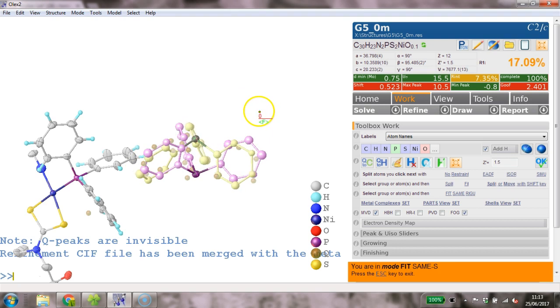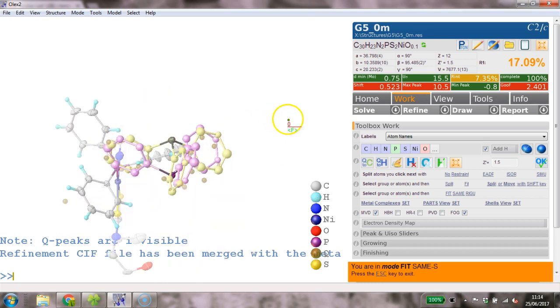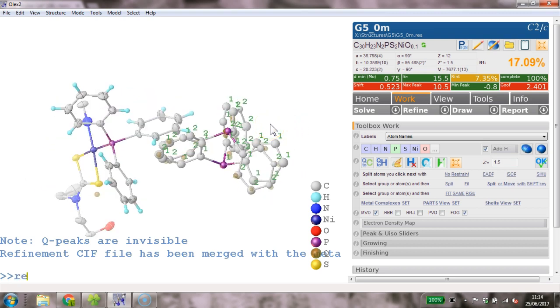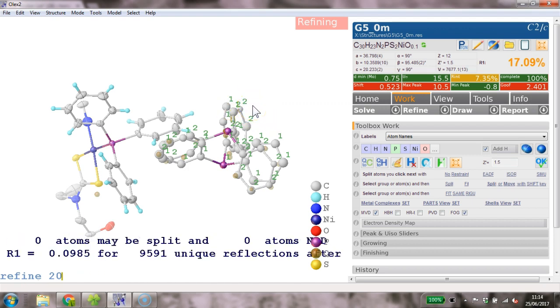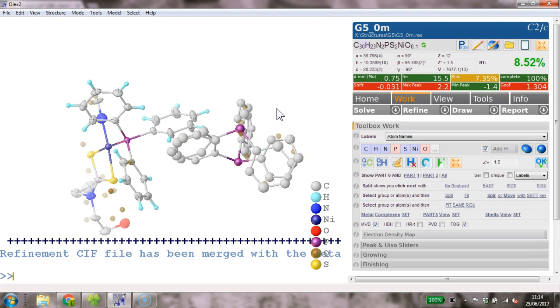So now let's just turn around. Yeah, this is not so bad. I sort of got that more or less where the peaks are. Maybe this needs to go down a little bit on this side. Okay, it doesn't have to be too accurate, but the closer you get, the easier it'll be later on. Hit escape. So we've modeled this disorder, and I'm going to type refine and give it some 20 cycles so it has a chance to settle. These are the part numbers shown at the moment, and I will switch them off because we don't really need to look at that. F3 toggles there.